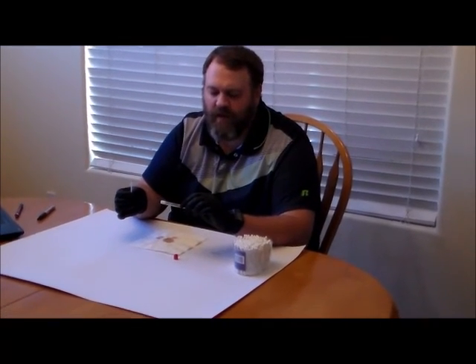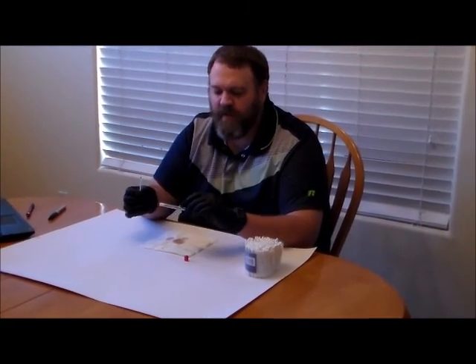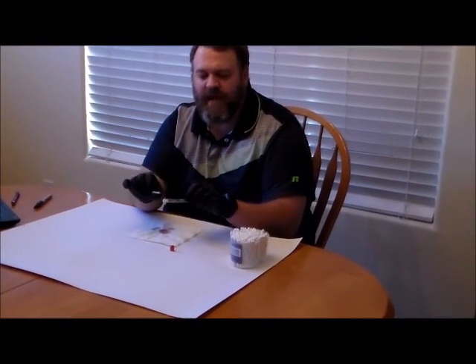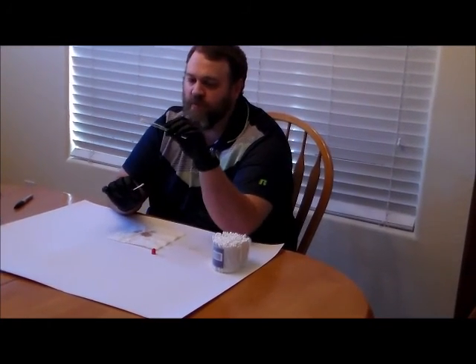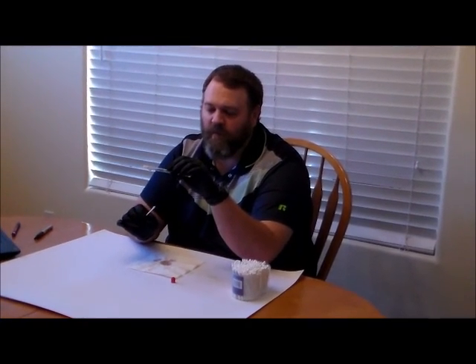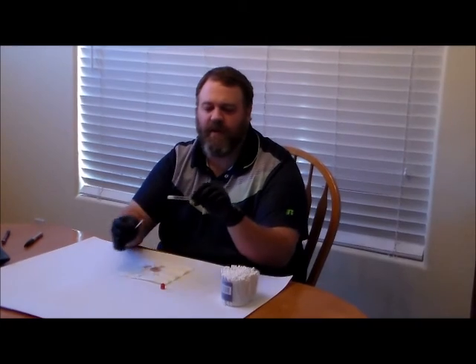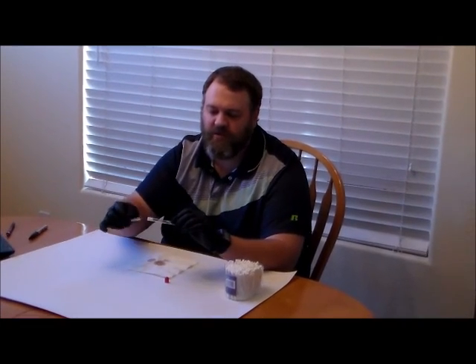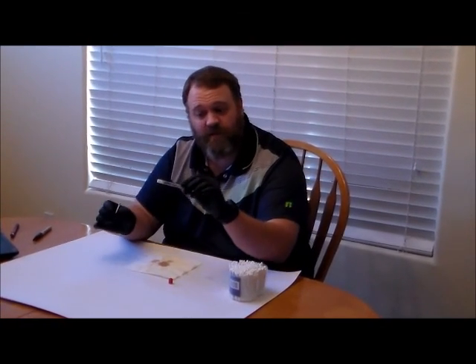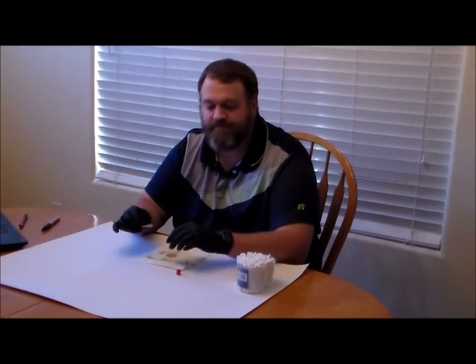The reason we didn't do the test this way for our exercises is that whenever you touch the end of it, you contaminate the end of it. So you really can only use this once using it this way. You wouldn't want to use the same one to test multiple things because you've already contaminated the end by touching it. But anyway, that's how these are done in the field — so if you ever have to use these on the job, now you know how it's done.